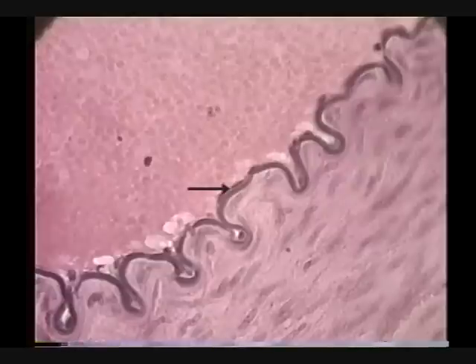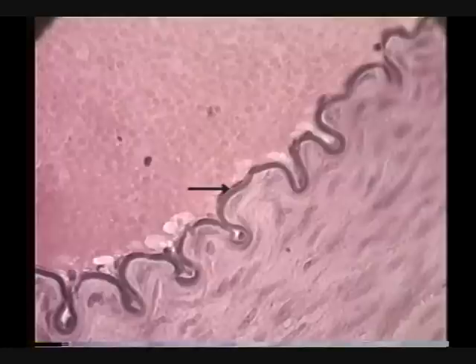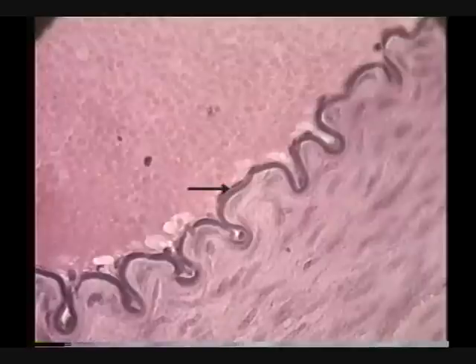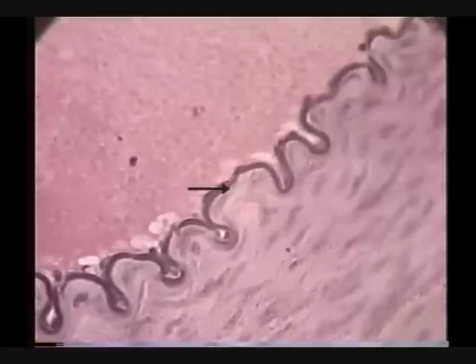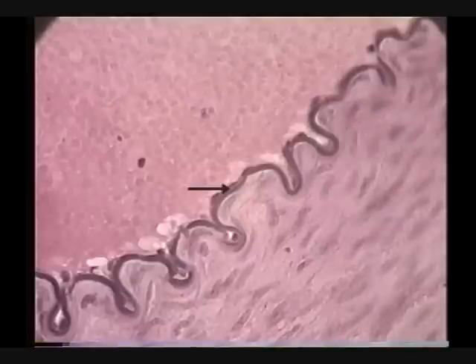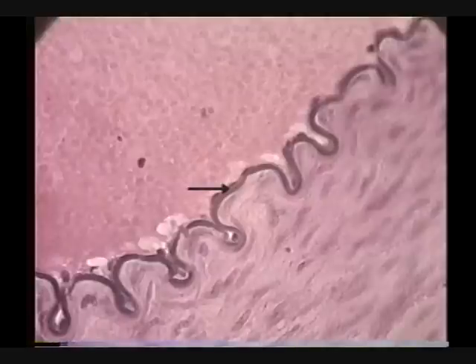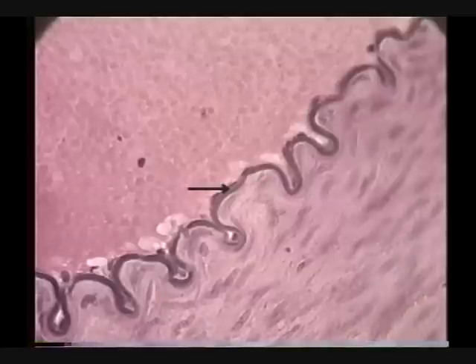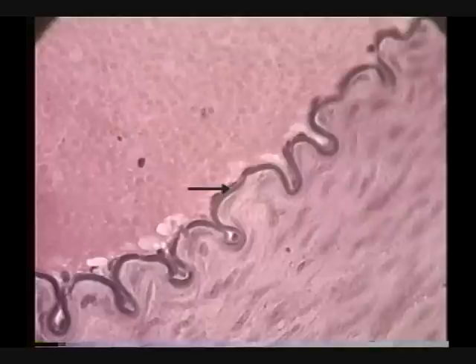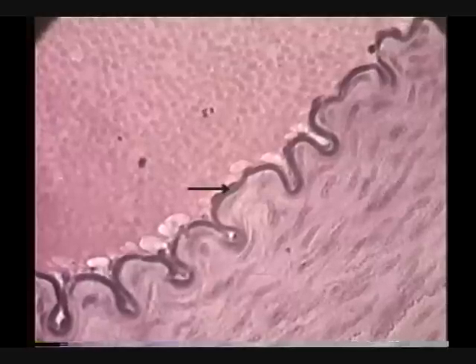What tunic is that? It's the tunica intima — just that layer of endothelium and a tiny bit of basal lamina, and there may or may not be some connective tissue associated with it. But what is this very distinct, darkly stained layer? If I just move the pointer a tiny bit deeper, this layer is the internal elastic lamina. This internal elastic lamina would be straightened out, and it gives a lot of elastic support to that vessel.